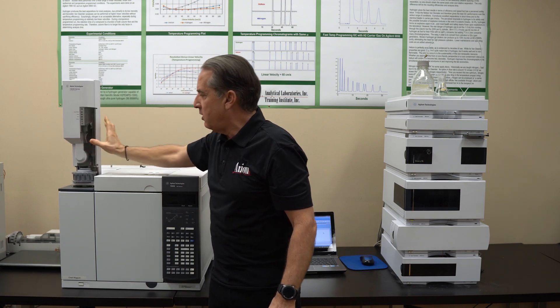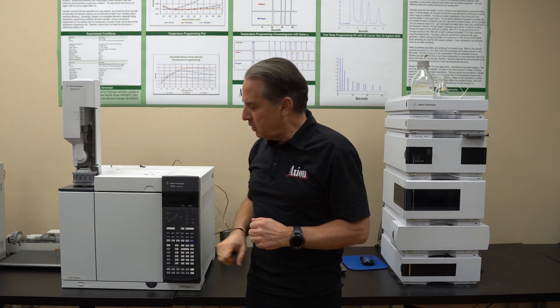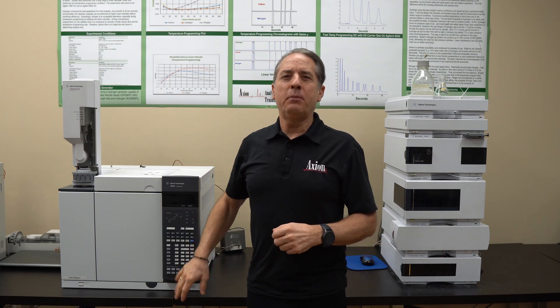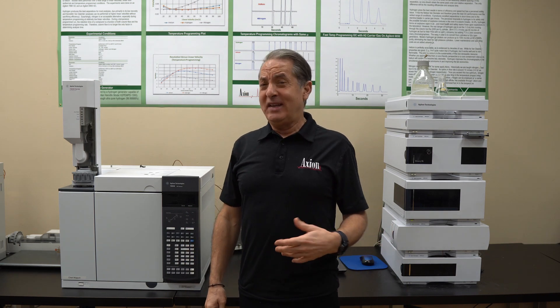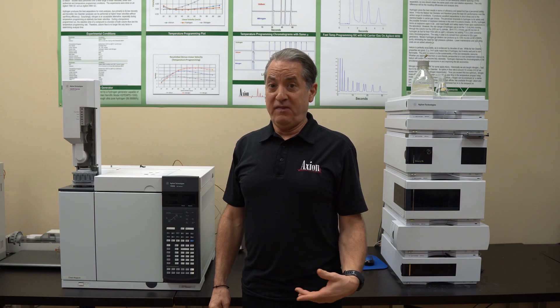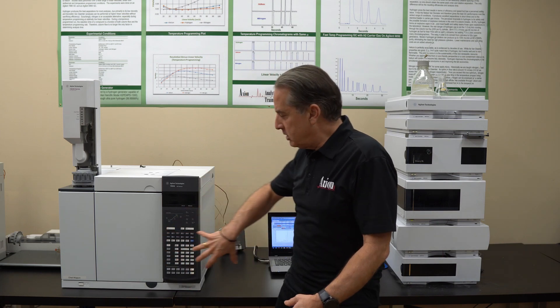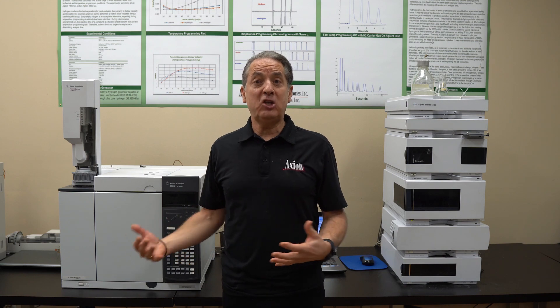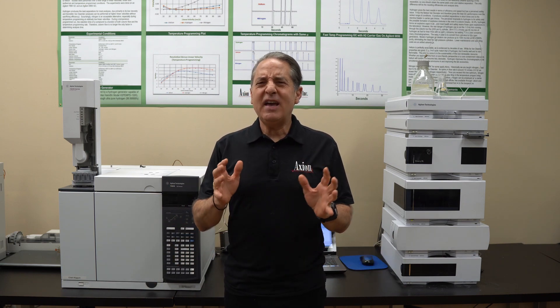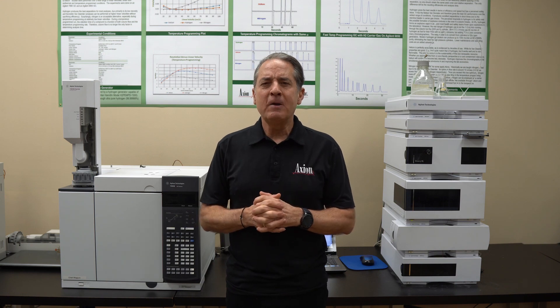If you still get no peaks after removing the auto sampler, it must be something else in the GC. Another cool trick: we can output what's called a test plot — it's an electronic chromatogram, what I call a fake chromatogram, stored in the memory of the GC and output to your data system. That's a way to check whether the data system is hooked up properly. So the GC has ways to half-split and isolate individual parts.